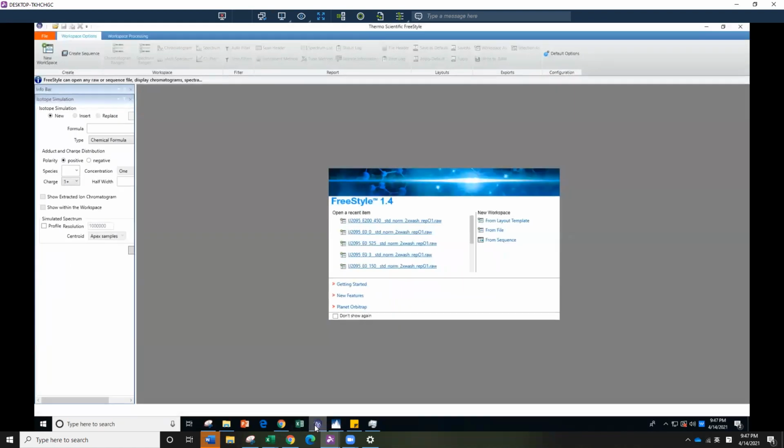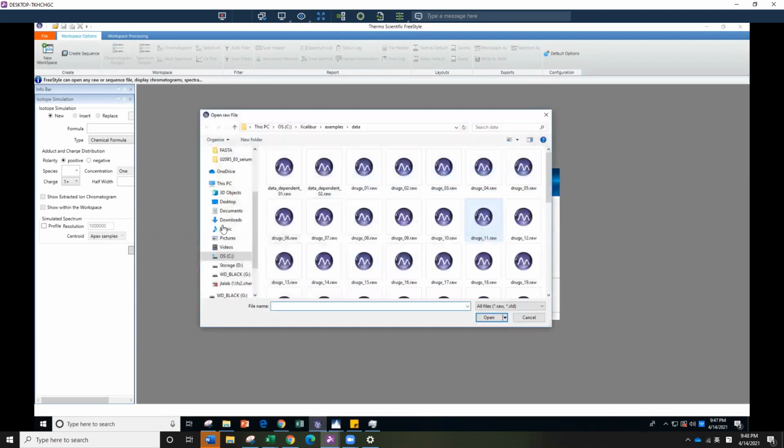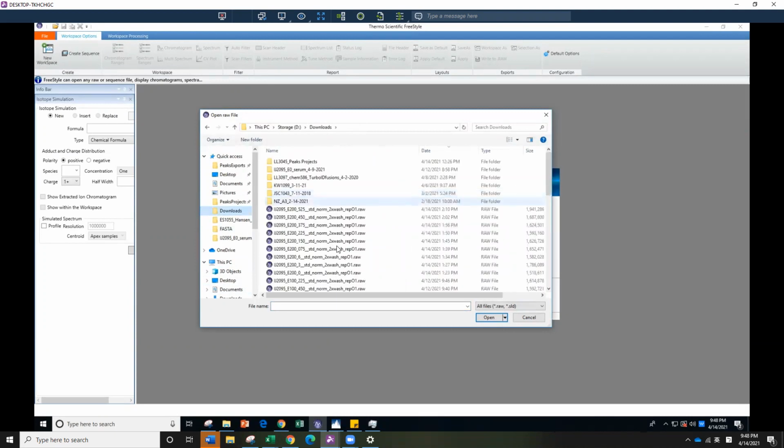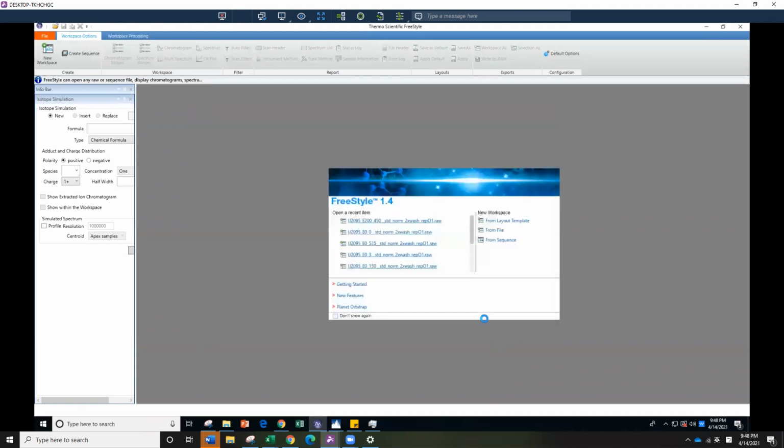Just a warning that FreeStyle takes a long time to think. It is a really time-consuming process, especially if it is running another analysis in peaks. So go to where your files are. Like I said, it takes some time. Select one of the files that you want to look at. Start with one first. Okay, so you open the file.